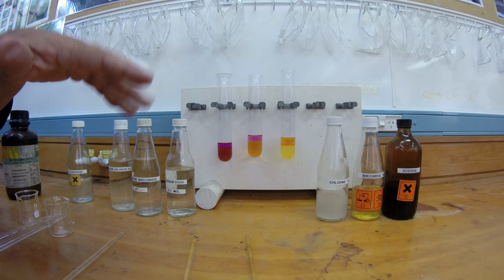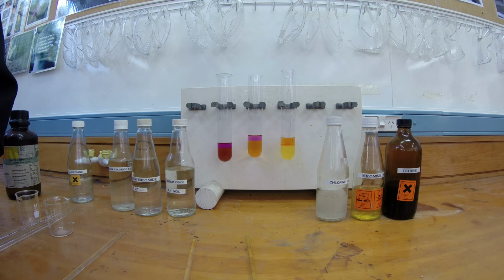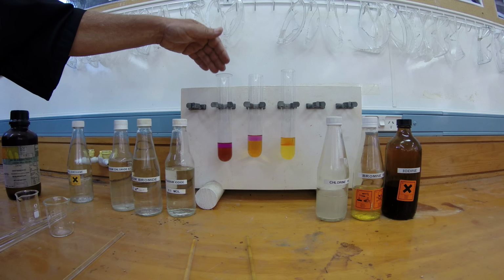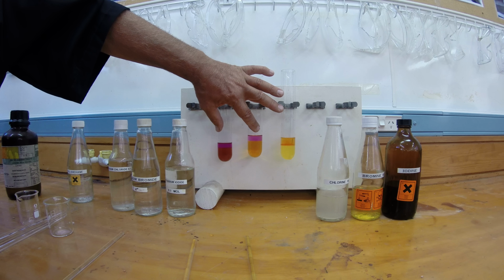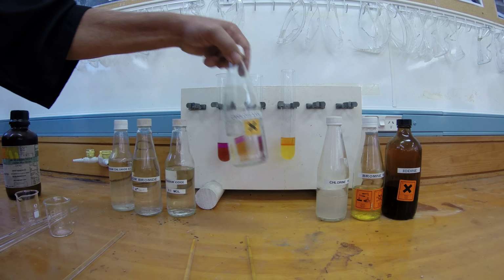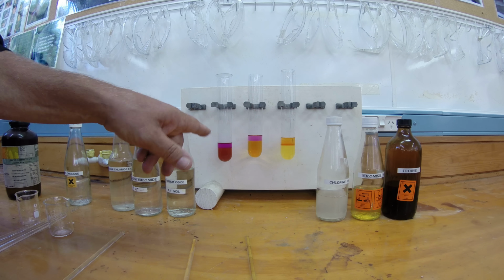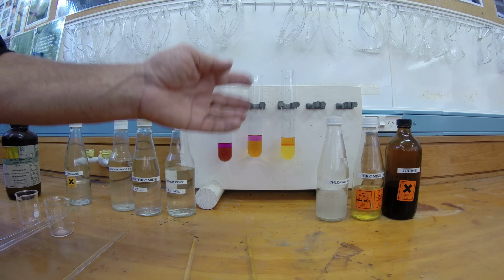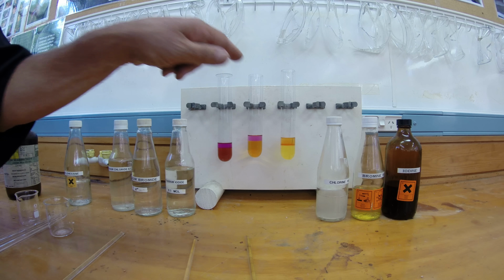Given that the colours of these don't vary very much, you couldn't really tell what it was that you'd produced. However, this purple colour here and here is a positive test to show that iodine, I2, has been produced, because iodine has a purple colour in organic solvents, such as cyclohexane. Bromine does not; it remains its orange colour. However, in all 3 cases, the iodine or bromine is more soluble in the non-polar organic layer on the top.